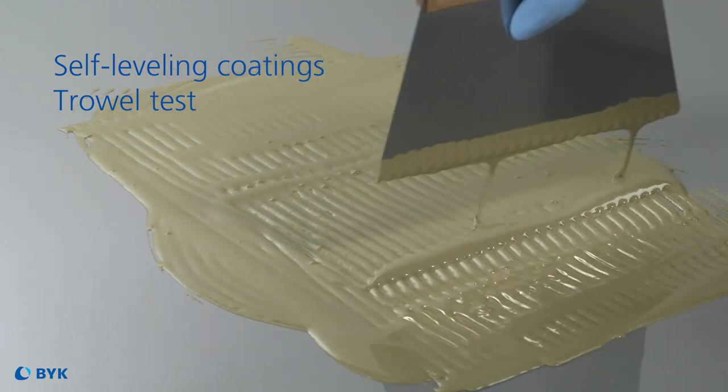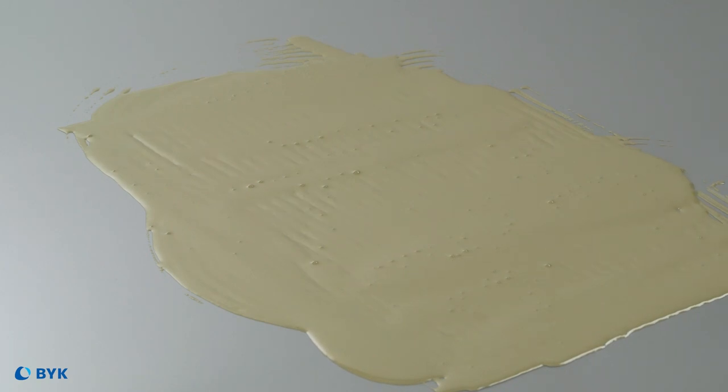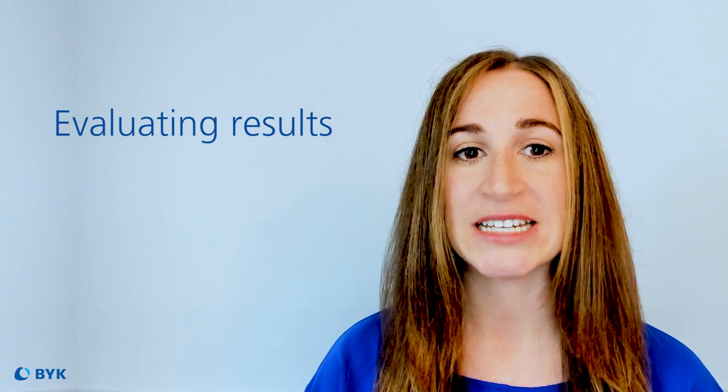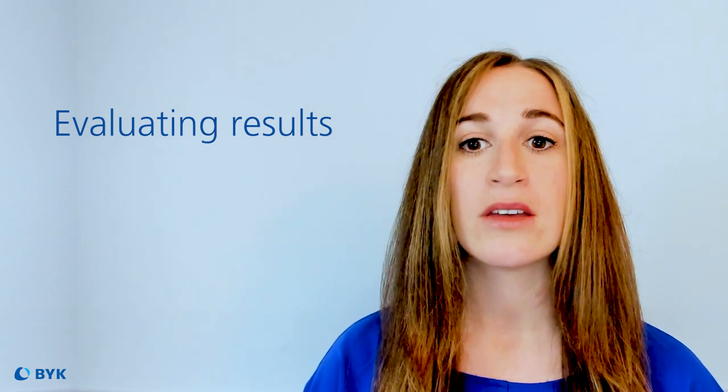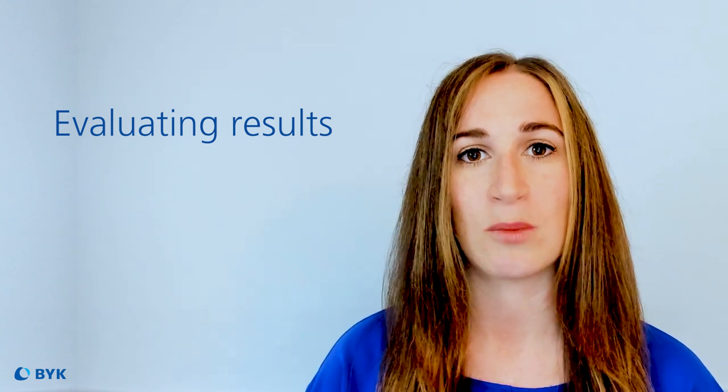The coating is poured on the substrate and a trowel is used to spread the material in a destructive way to incorporate foam. The foam bubbles will disappear rapidly when a defoamer is added to flooring systems. As I listen to you both review the many tests, it's clear that we try to simulate various scenarios with different shear and the impact and efficacy of our defoamers.